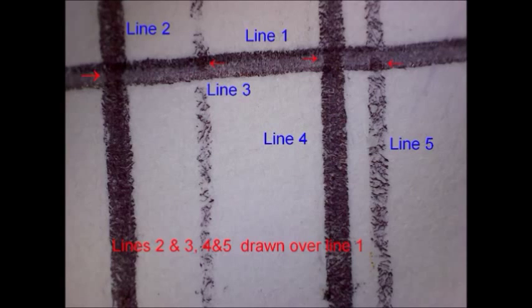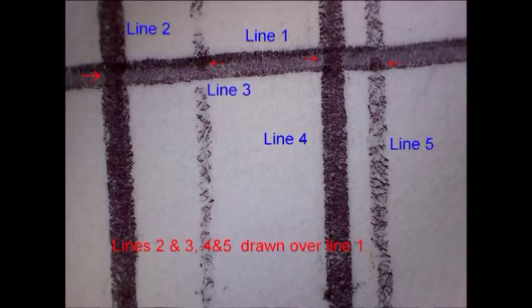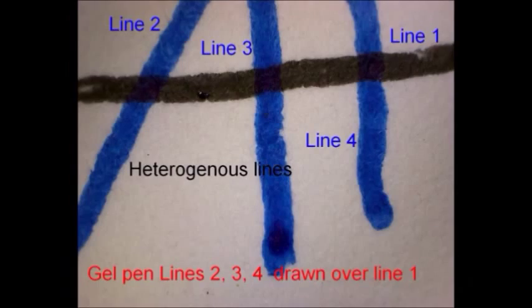If you have something written and a signature where part of the signature goes over the original writing, the question is which came first — did someone take the signature and then write something to make it look like that person wrote it, or did the person write it and put a signature on there? It's not an easy problem to solve. I've even put together samples where I know the sequence — that pen A was used before pen B — and under the microscope it looks like pen B was used before pen A, because of the type of inks used.